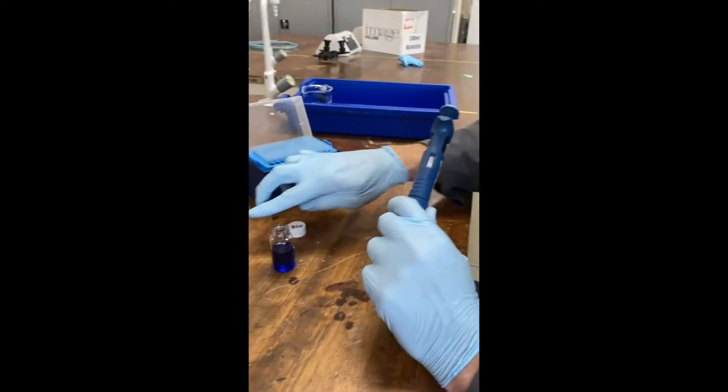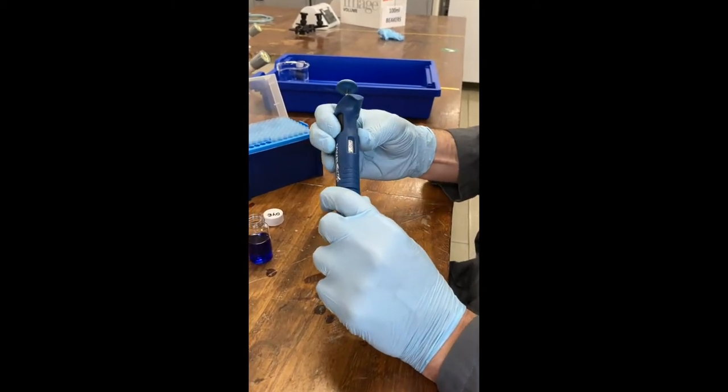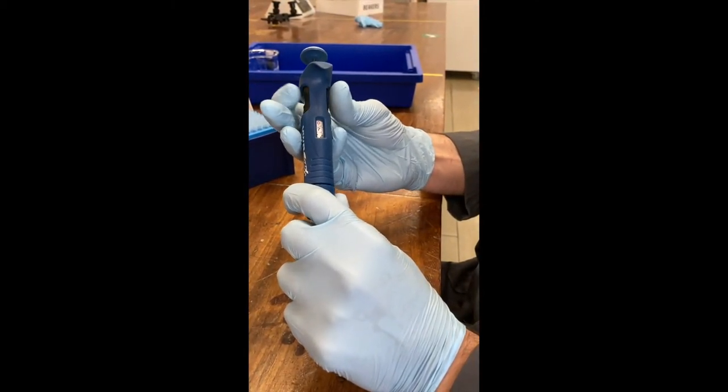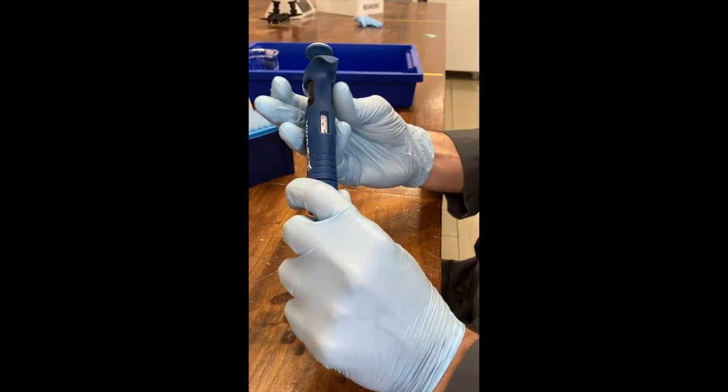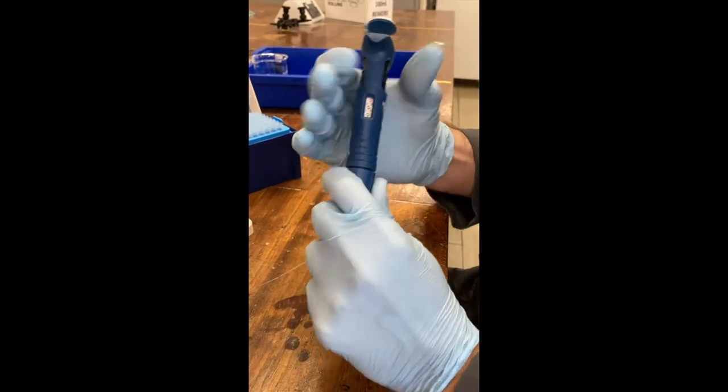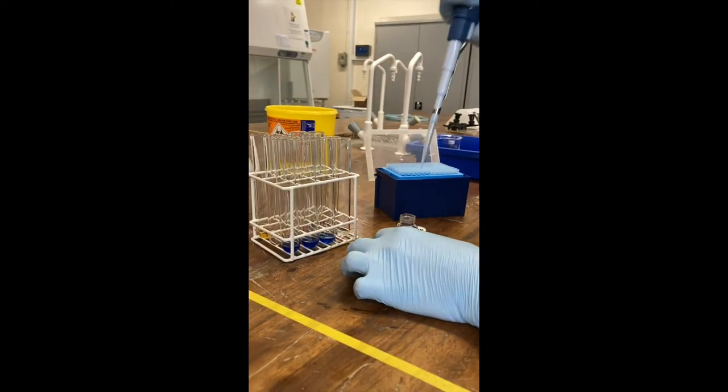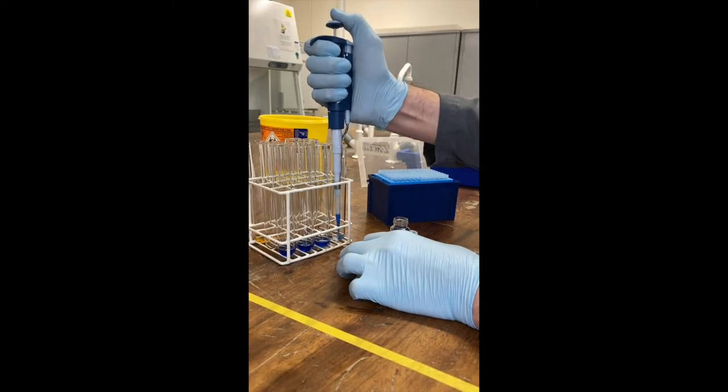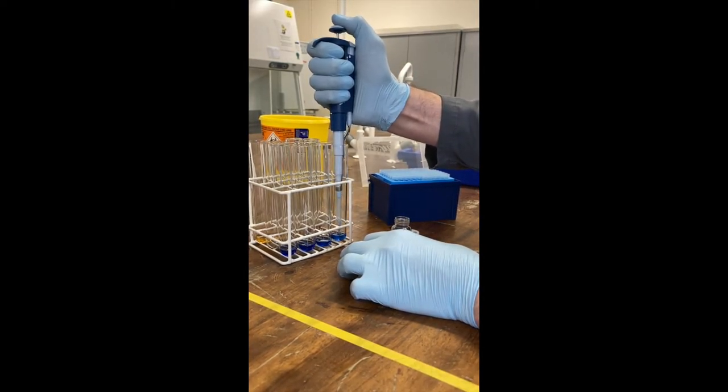Now for the final one, I have one and a half mils of water. So I'm only going to go down to 500 on the pipette. Make sure you lock it. And pipette up and down a couple of times.